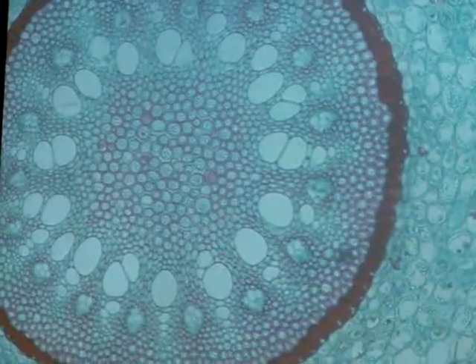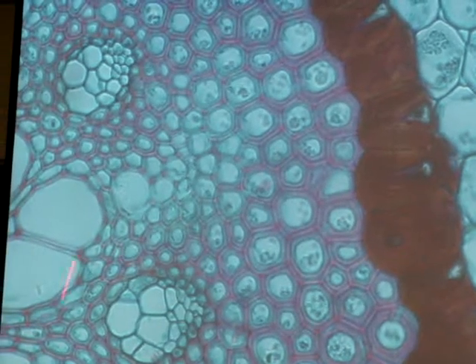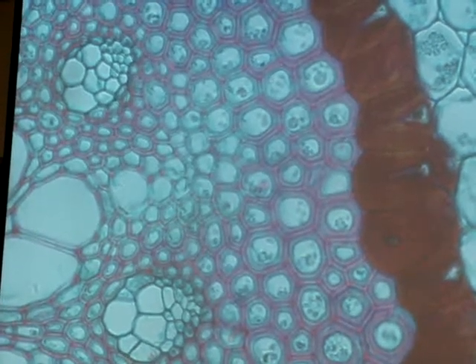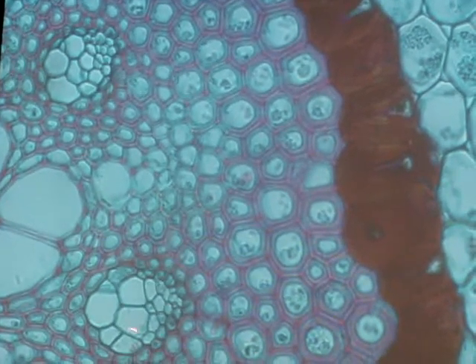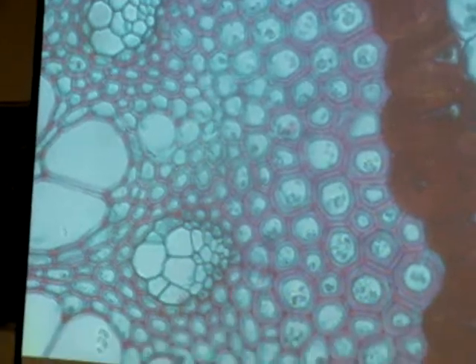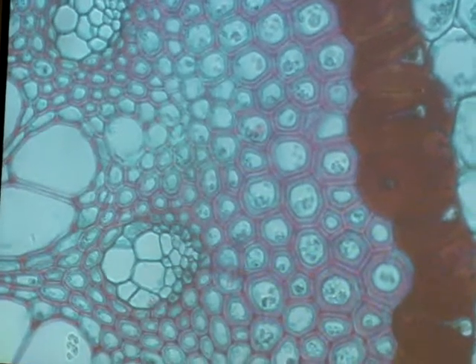More of the same. You can see the xylem bundles here. In this particular species, the xylem tends to coagulate evidently. You see some xylem here, you can see the endodermis. That's probably sclerenchyma, not testable. And you can see the phloem. So what's really testable here is the endodermis, xylem, and phloem. You guys with me?